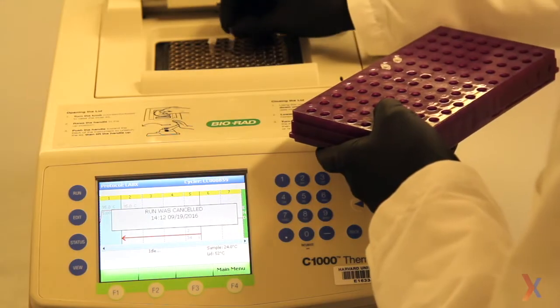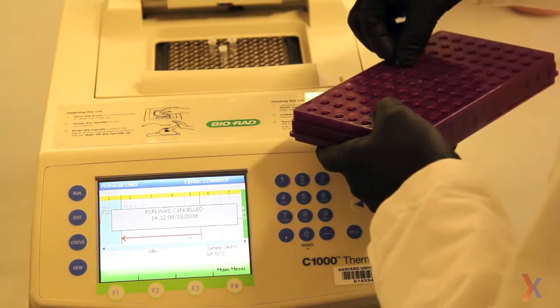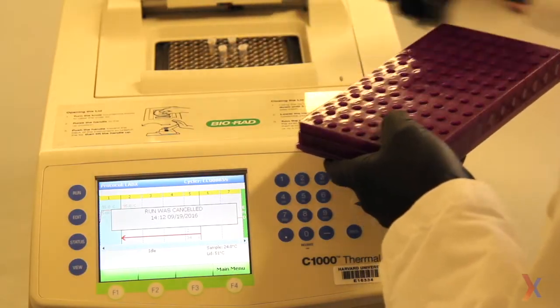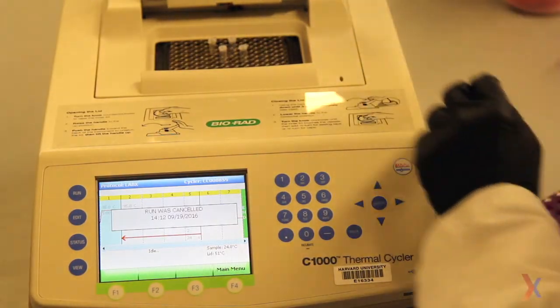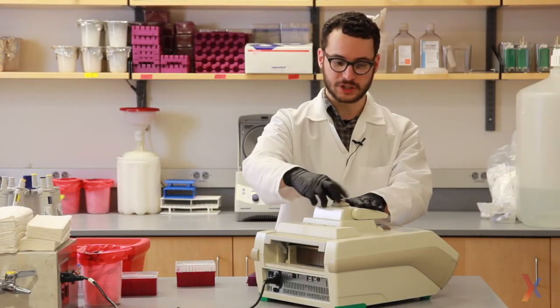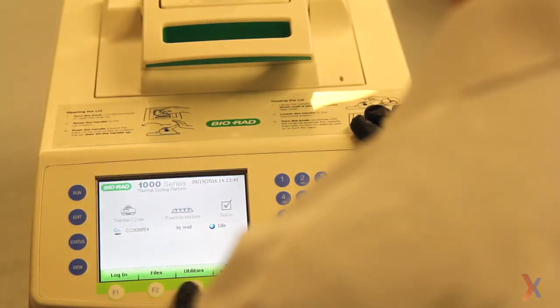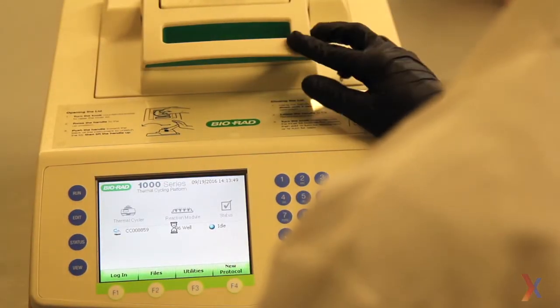I'll place them here in the center. I'll close the lid and tighten it. You may not need to tighten the lid on your PCR machine. And I'll click run. I'll come back when my PCR samples are ready.